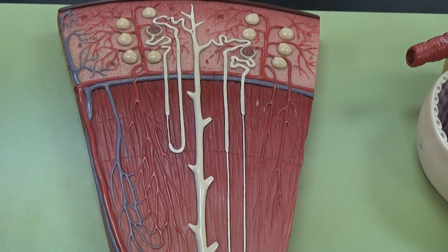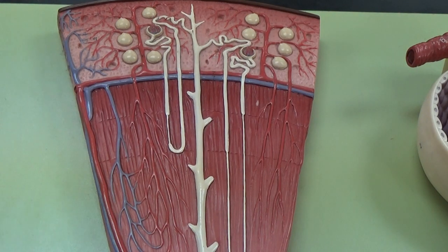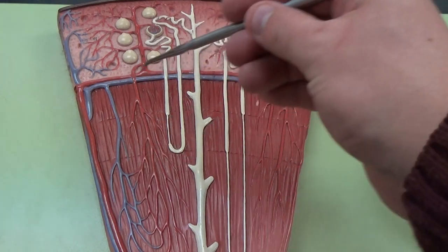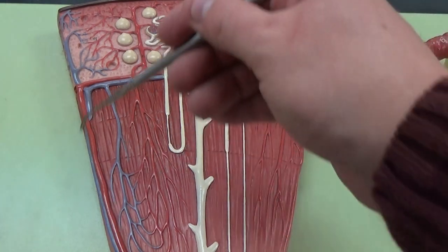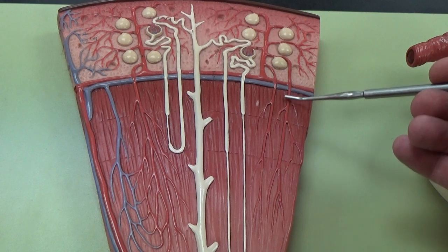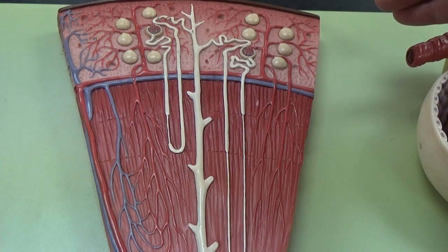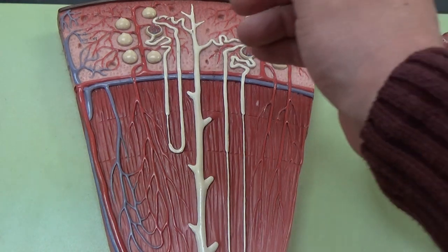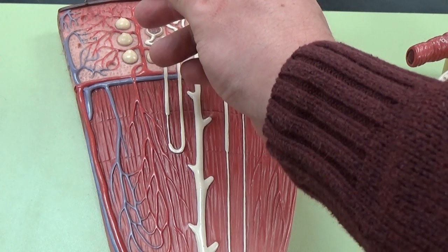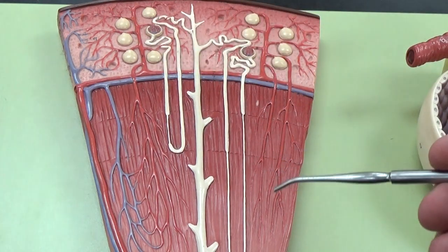Now we're looking more zoomed in from the kidney in this particular video. This is our renal pyramid, so this would be the medullary region and the cortical region. You can see way up here on top would be that renal capsule.